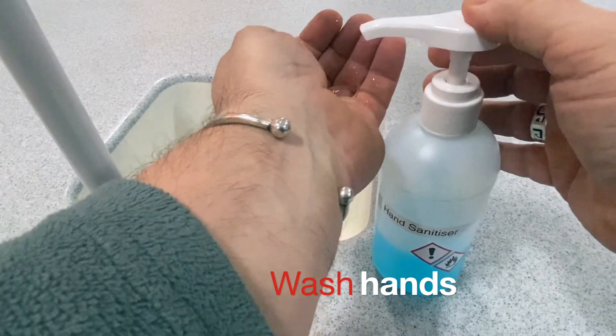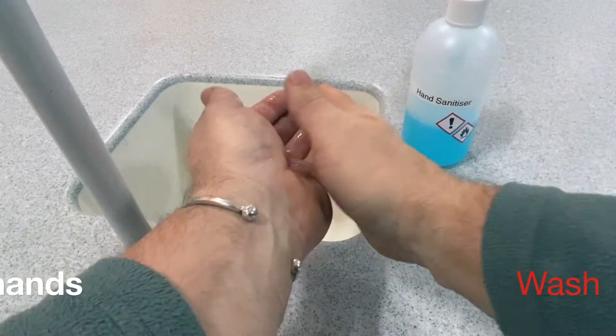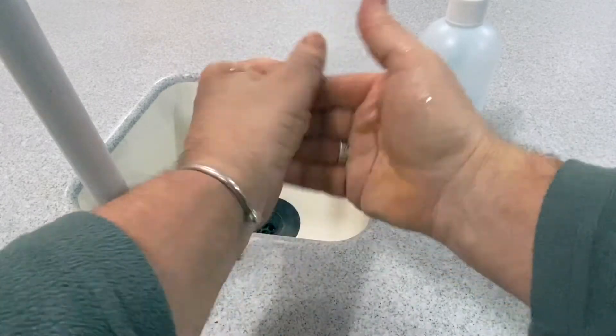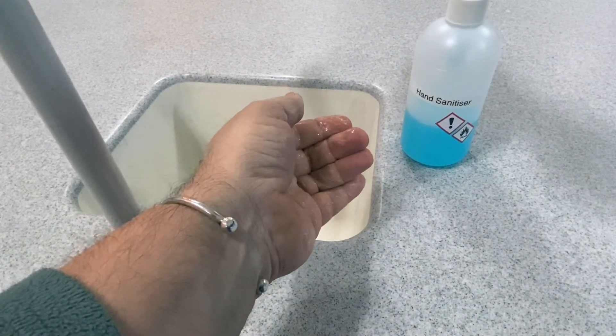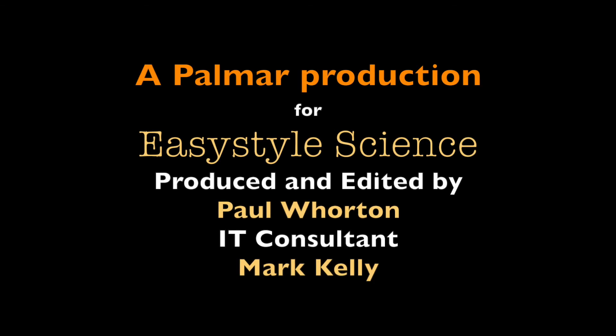At the end of the activity, the bench is sprayed and rewiped. And always remember to wash hands after being in contact with the bacterial samples.